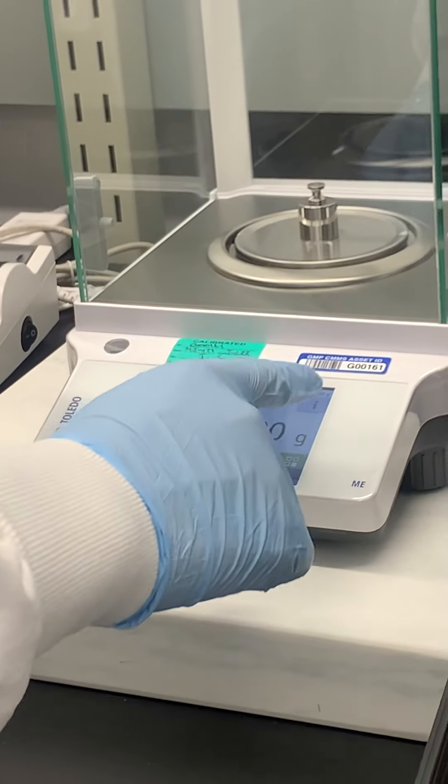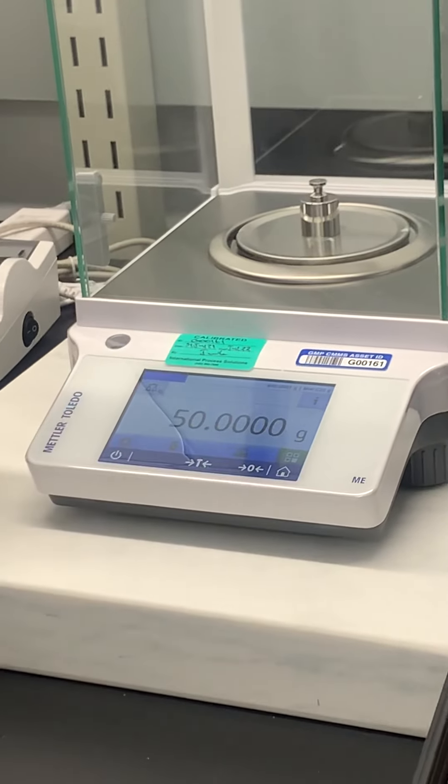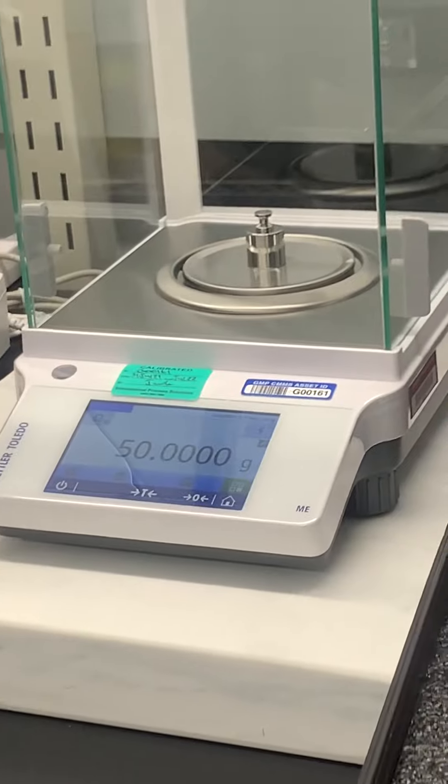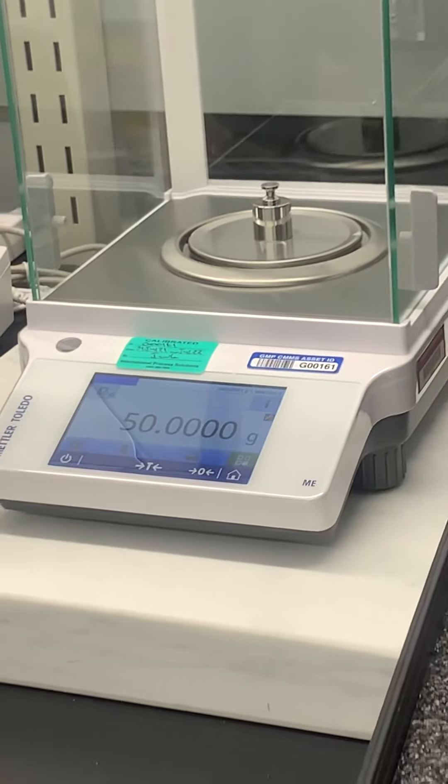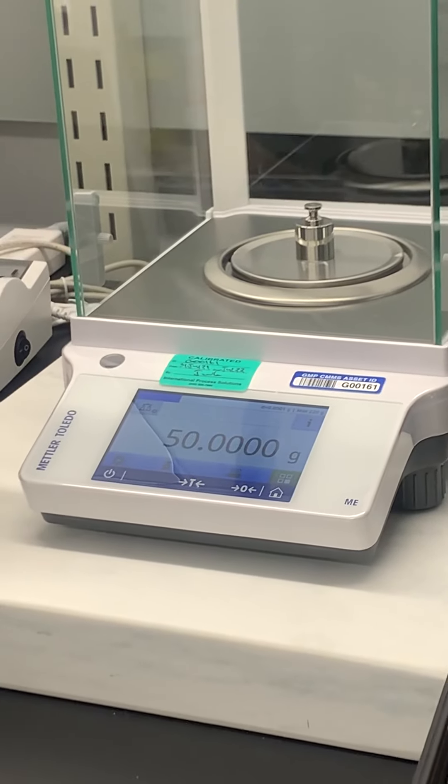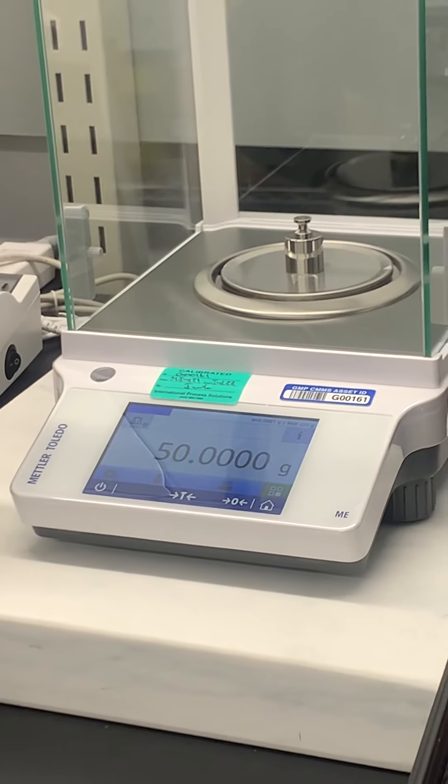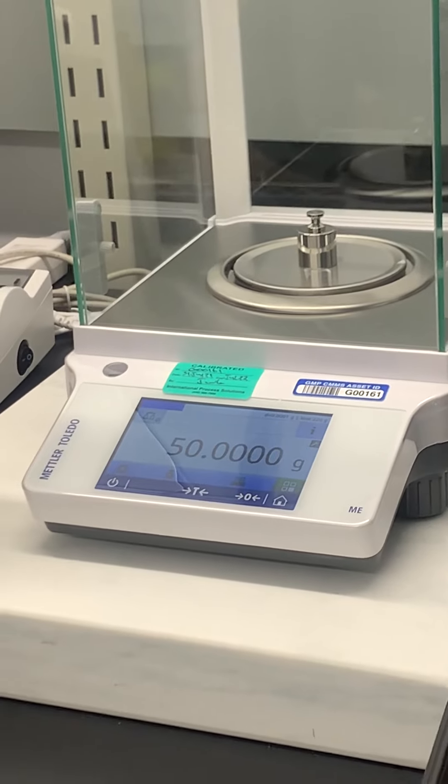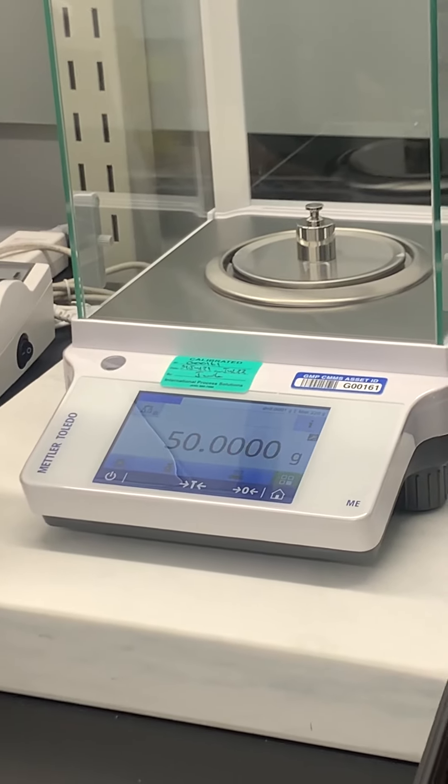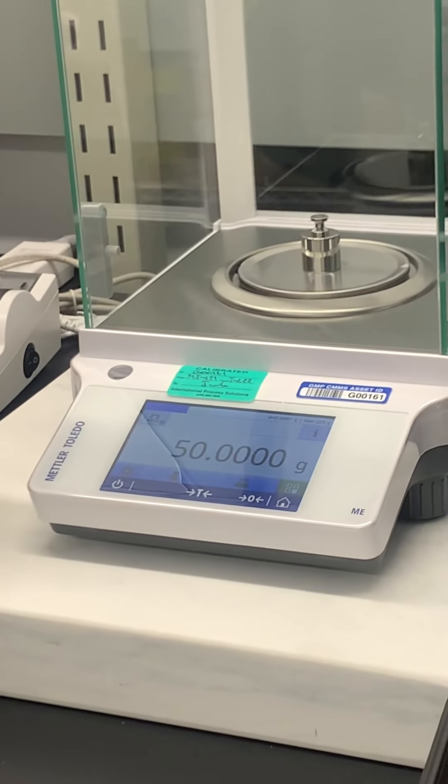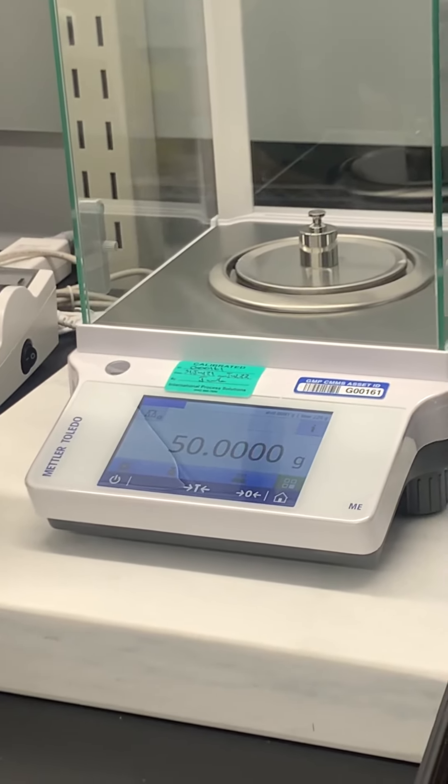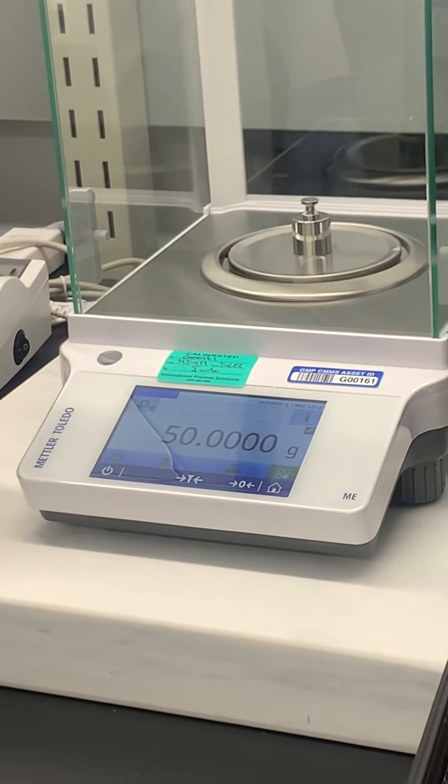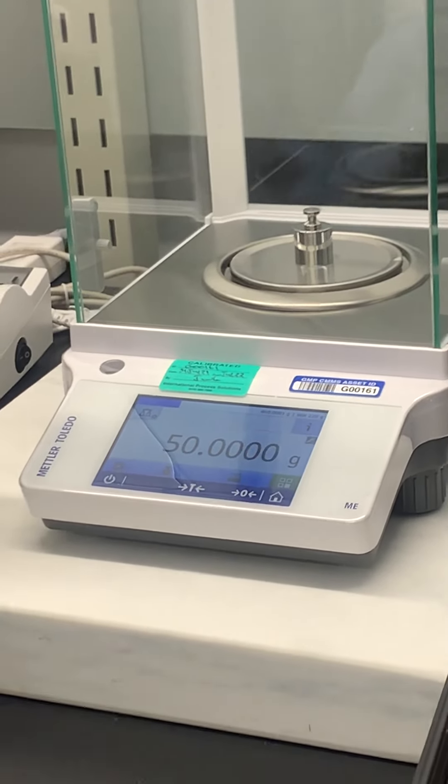Good to know. So this one's an old school one where it prints out everything that happens. Okay, so I just wanted to see what it would look like if I were to go into the adjustment screen, and it was like 'oh would you like to make an adjustment?' It's like no, not really. And then because I did that, it gave me like 'you aborted your adjustment.' Gotcha.